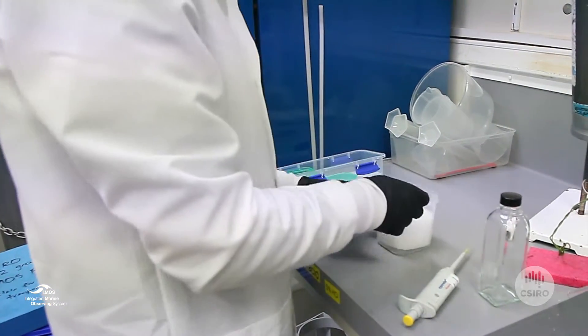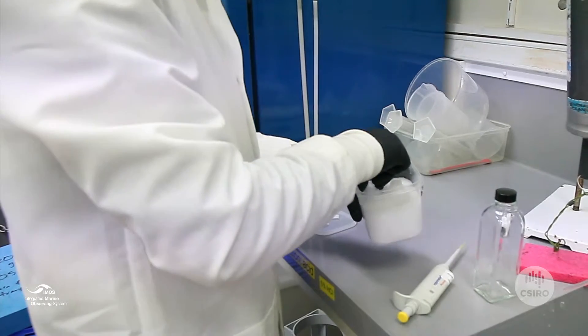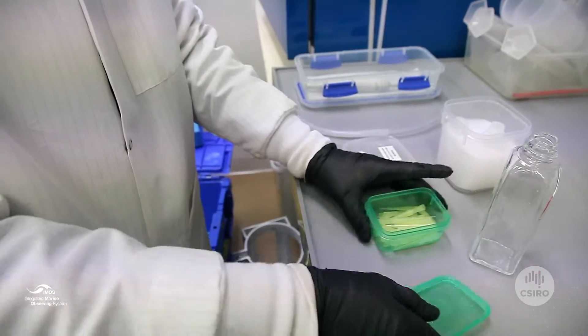If you get any on your skin, please wash it off. Get your pipette ready, take out a tip, and fit it to the pipette.